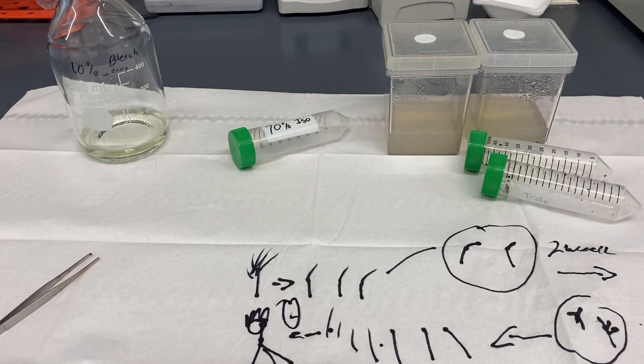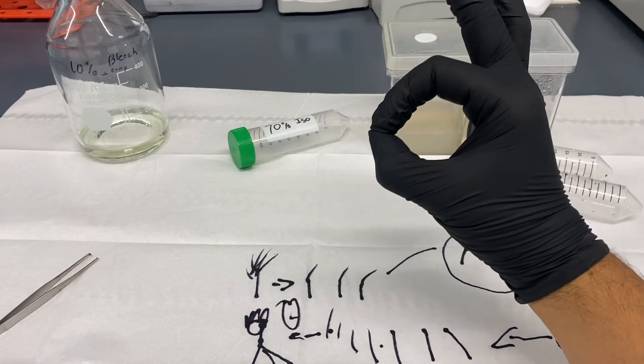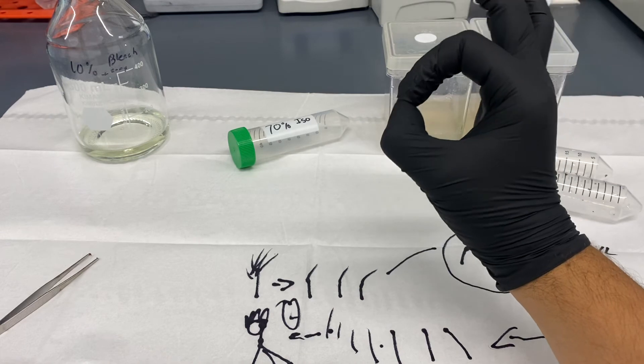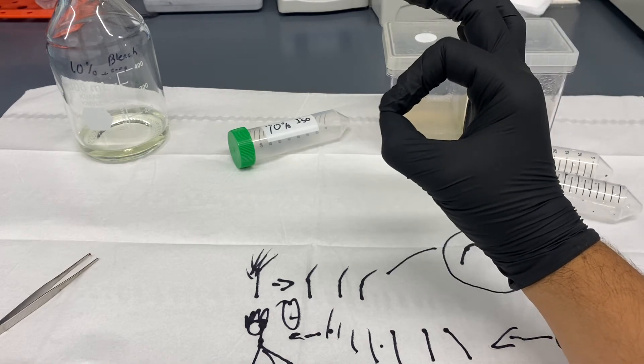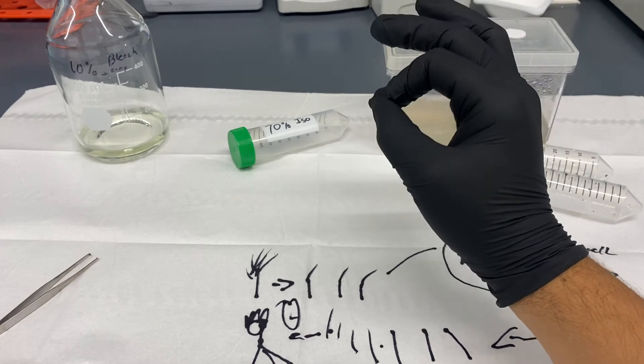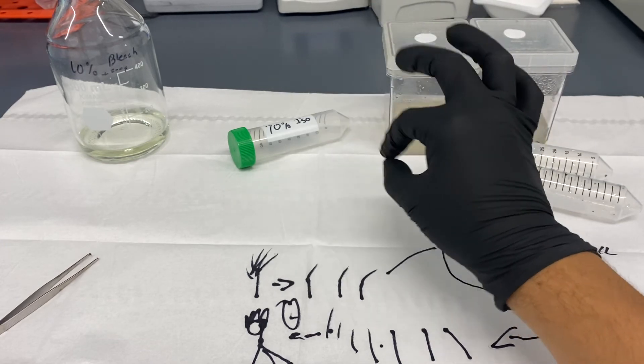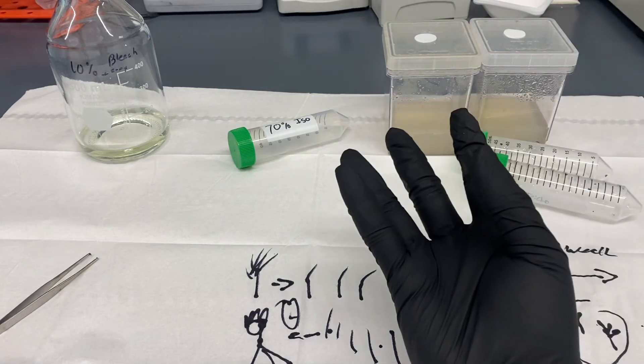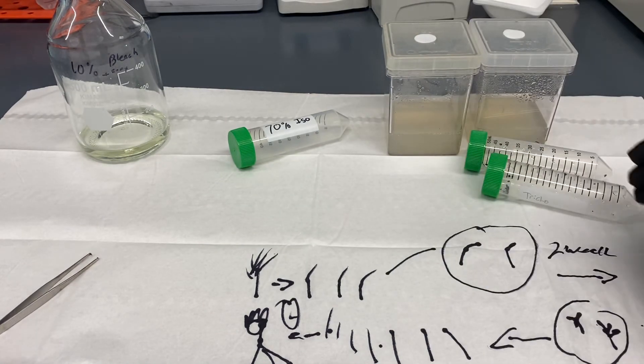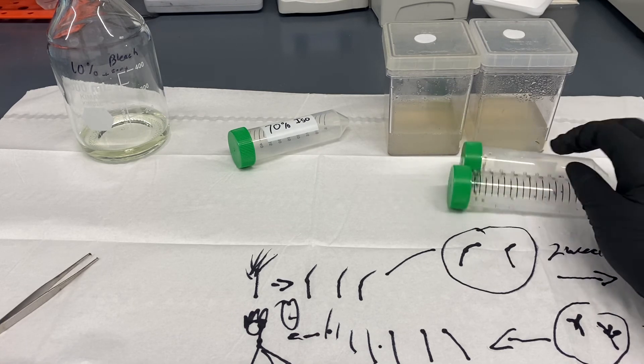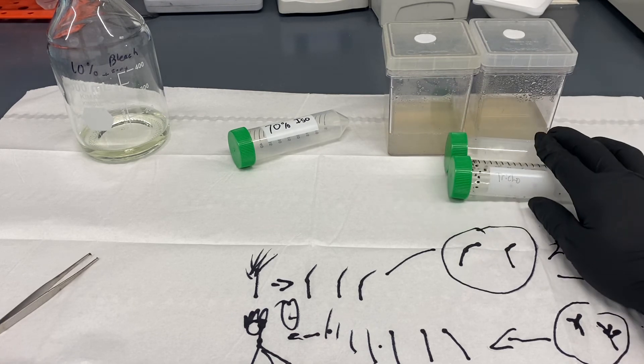And then eventually I'll have it with roots and shoots or whatever. I mean it's a cactus so who knows. But you get the point. So the idea is I take one cactus, maybe a Lophophora, very slow growing, circular like this. I can cut up each tuft, so every white little fluffy wooly spot that you see I can cut up and place on media in hopes that it regrows into a new cacti.